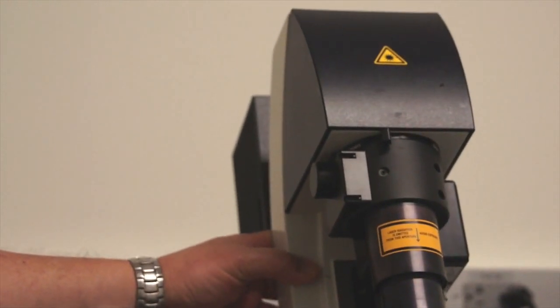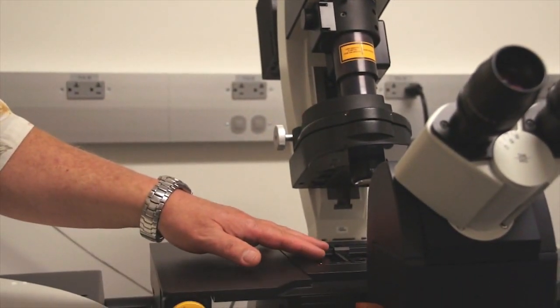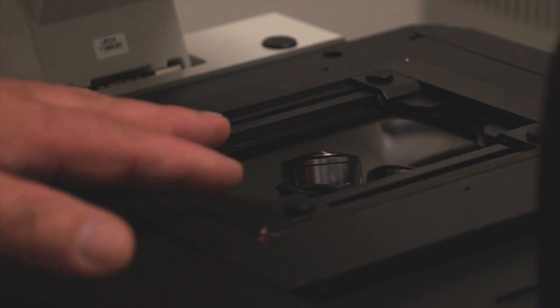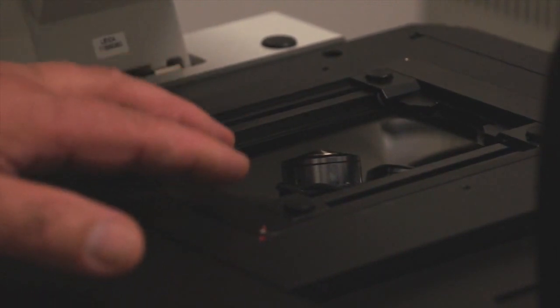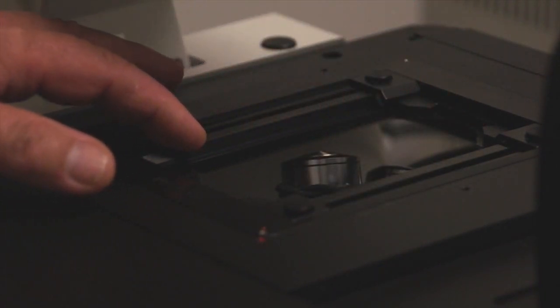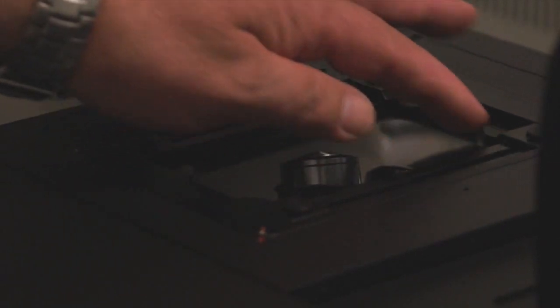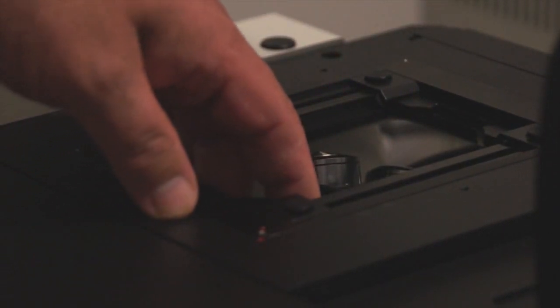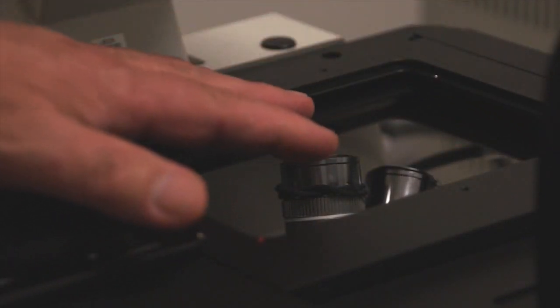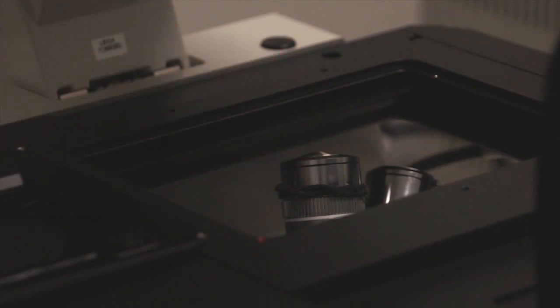And this is important because often we work with large culture dishes that fit in here on the stage. And so with an inverted microscope, we have the ability with stage inserts to use multi-well dishes within which we grow cells. So if you're culturing cells, you can use a small dish that will fit into this space or the entire insert will come out and you can use larger dishes or we can purchase additional inserts to accommodate the kind of specimens that you're working with.